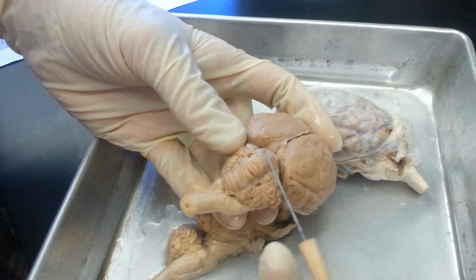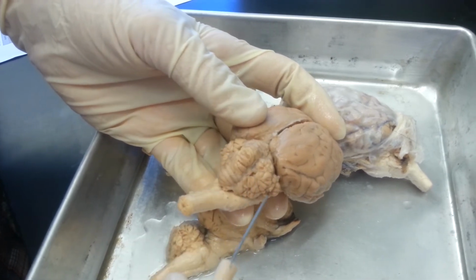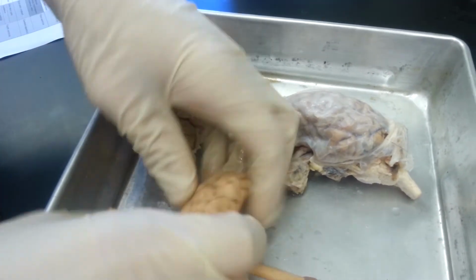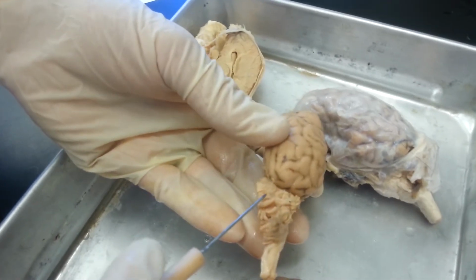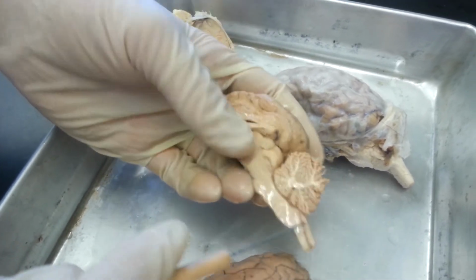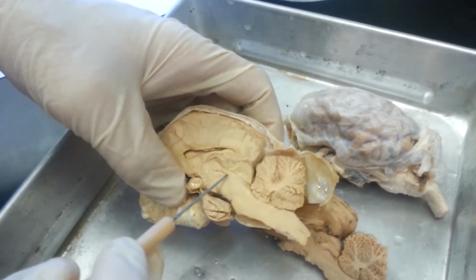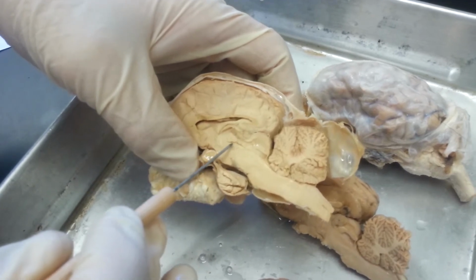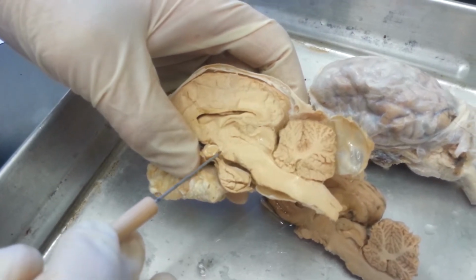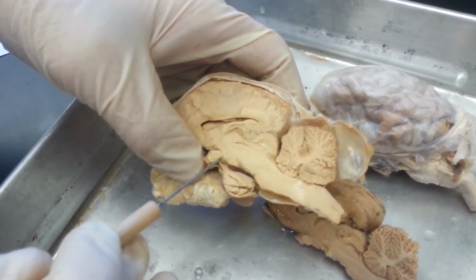The big raised portion in the middle is called the vermis, and the raised portions on the sides are called the folia. If you split it in half, it also has cerebellar hemispheres. So this is the right cerebellar hemisphere. Again, I'll switch to this one. The big structure in the middle here is called the thalamus. Below the thalamus is the hypothalamus. And the structure connecting the hypothalamus to the hypophysis, or the pituitary gland, is called the infundibulum.